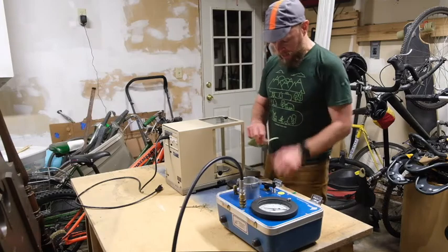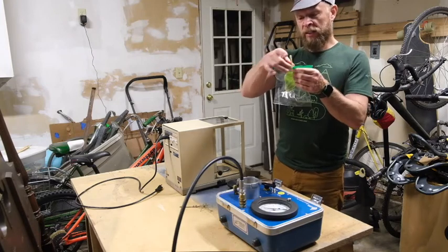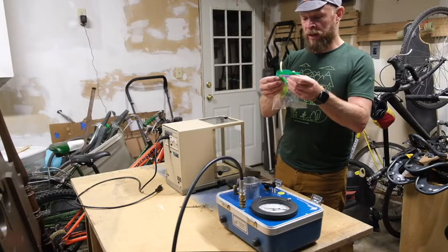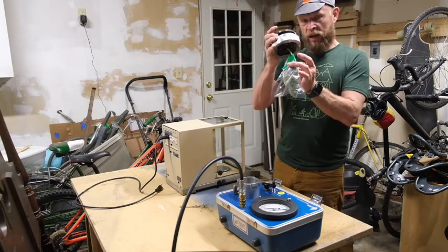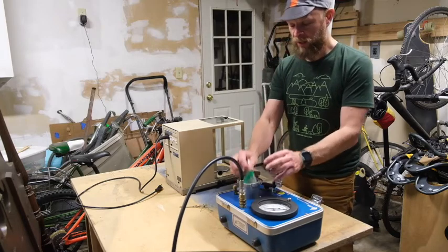Immediately after I weigh it, I'm going to put the lamina in the plastic bag, leaving the petiole sticking out. I would not seal this up perfectly, but seal it a little bit. And then this would go through the bottom of the chamber head. Then the leaf would go inside the chamber here, and I would measure its water potential.